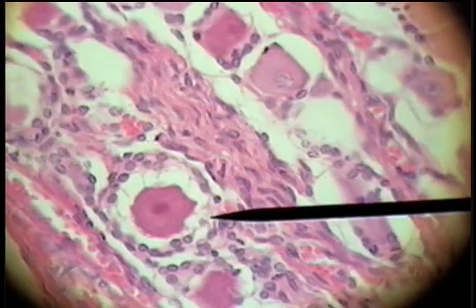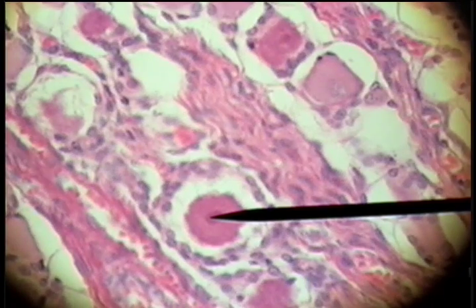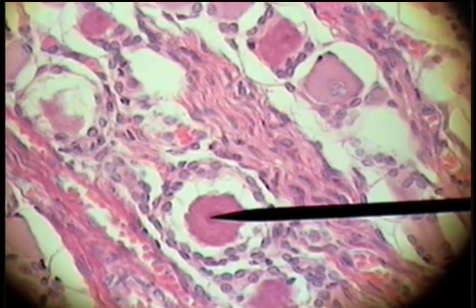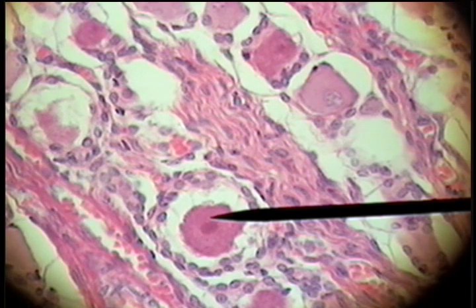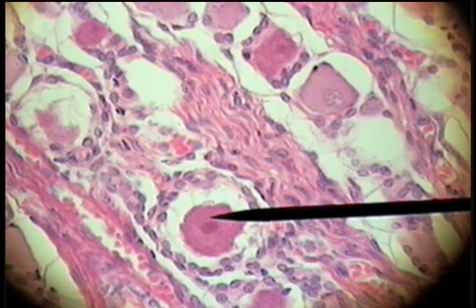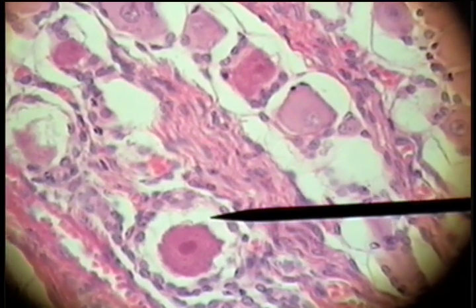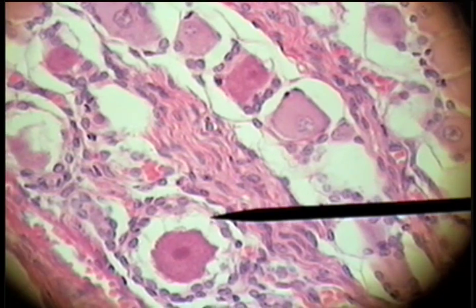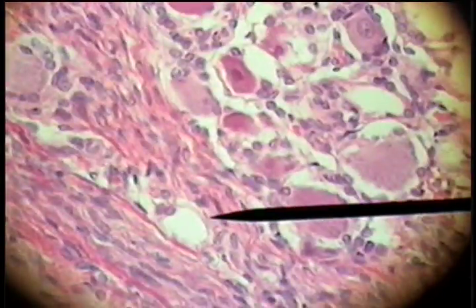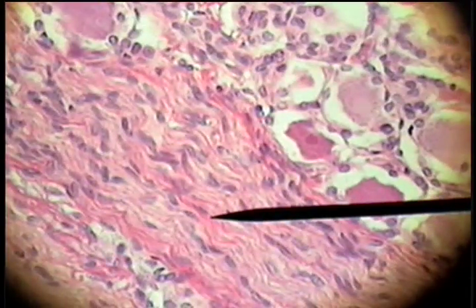There's one nerve cell body here, and another nerve cell body right there, with the nucleus in the center. The nucleus is what we're looking at, and surrounding the nerve cell are these capsule cells here.